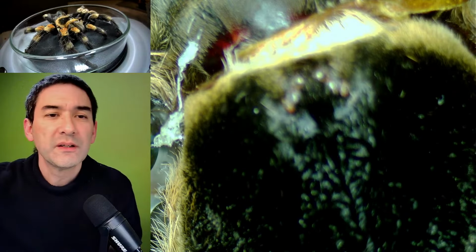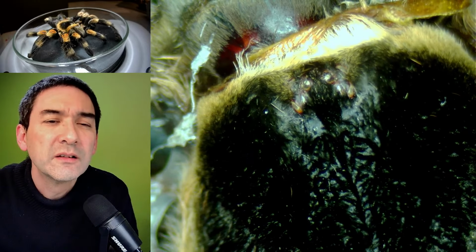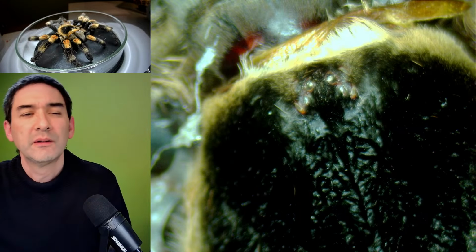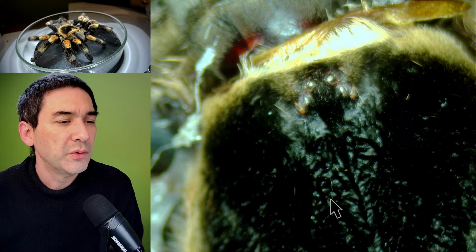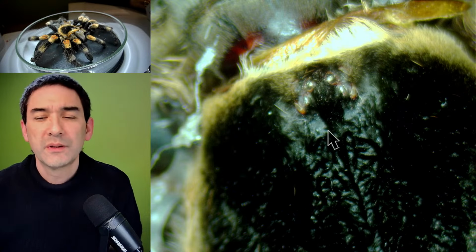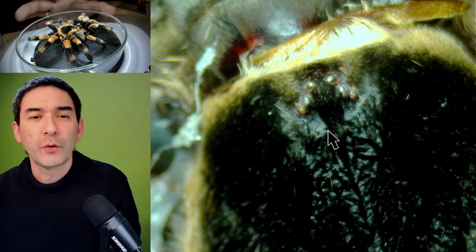This is the problem, that the contrast is not quite right. Maybe these are the eyes here. What do you have? This could be, again, I'm turning on the arrow. Maybe these here. Okay, but I'm not sure about that. Yeah.